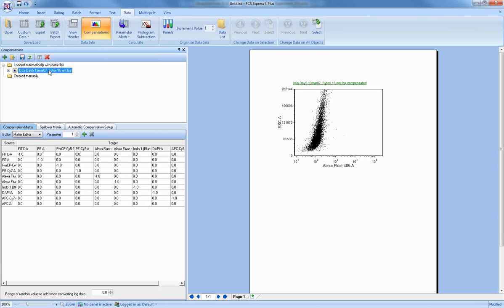You can change your preferences so that it doesn't automatically load. You can also set up your files initially without a compensation, and then as long as you have your single stain controls, you can create one manually. Now we have webinars to cover that topic, so I won't go through the details here, but you can handle all of that inside FCS Express.